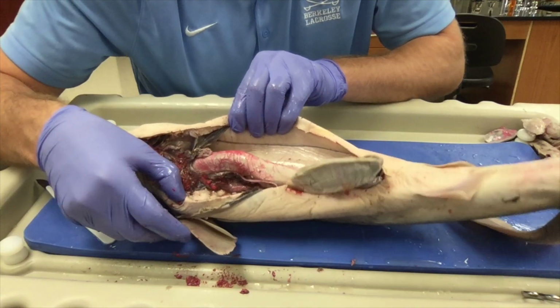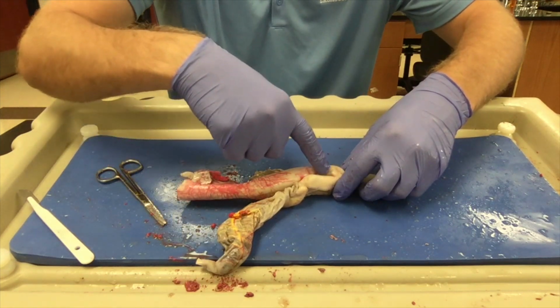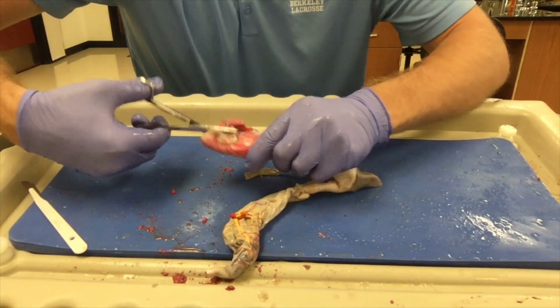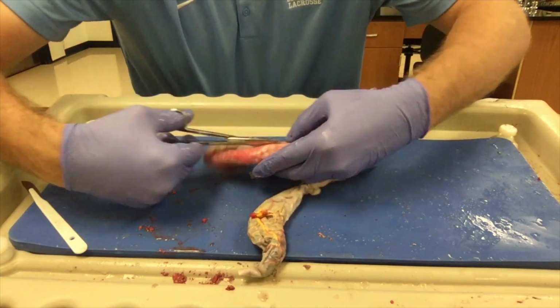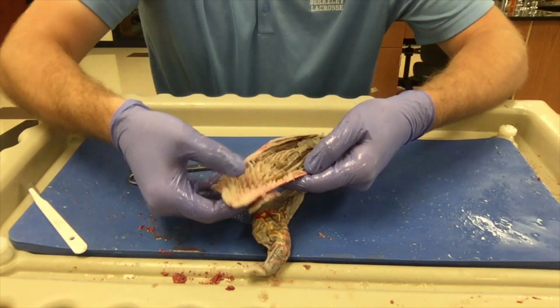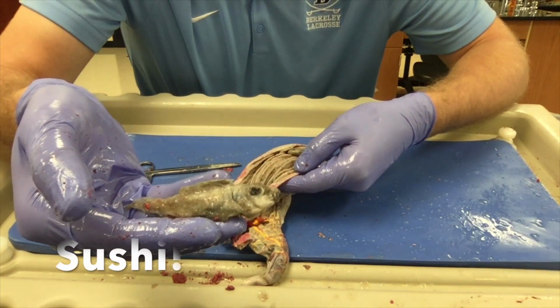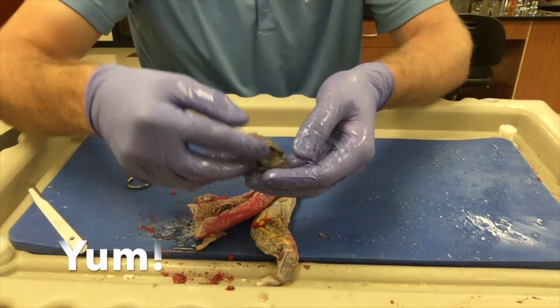Right, finally, we'll go ahead and remove the shark's digestive system. Here we see the shark's stomach leading down into its intestines. Let's go ahead and cut the stomach open and see what we find inside. The stomach is highly folded to increase surface area, and it looks like inside of the shark's stomach is a partially digested little fish. Oh, and a second one that's much more digested.